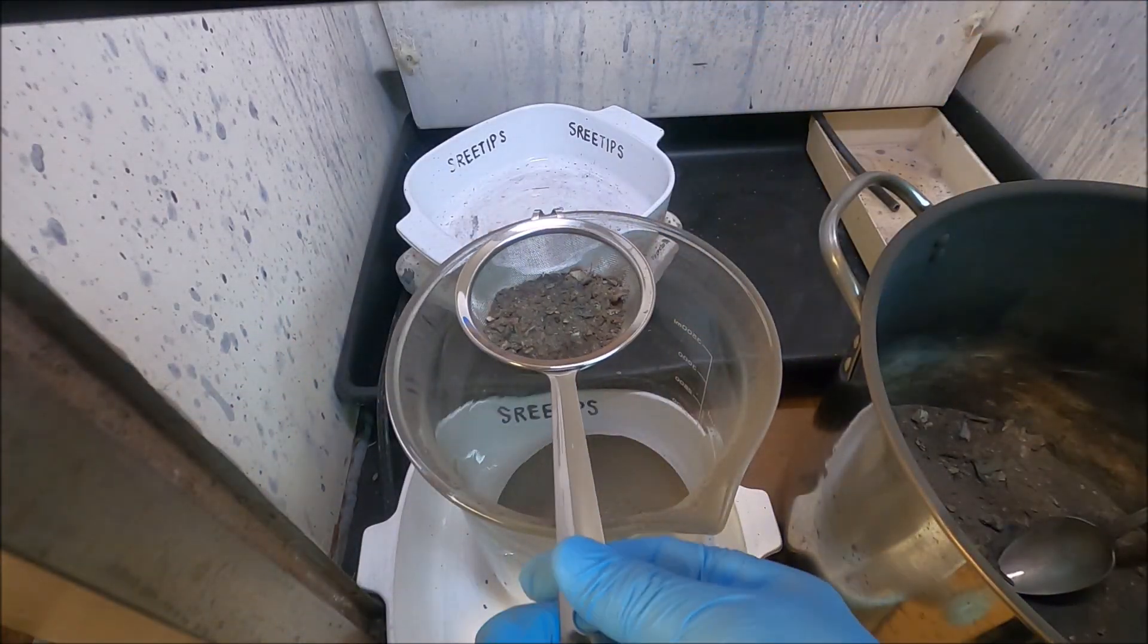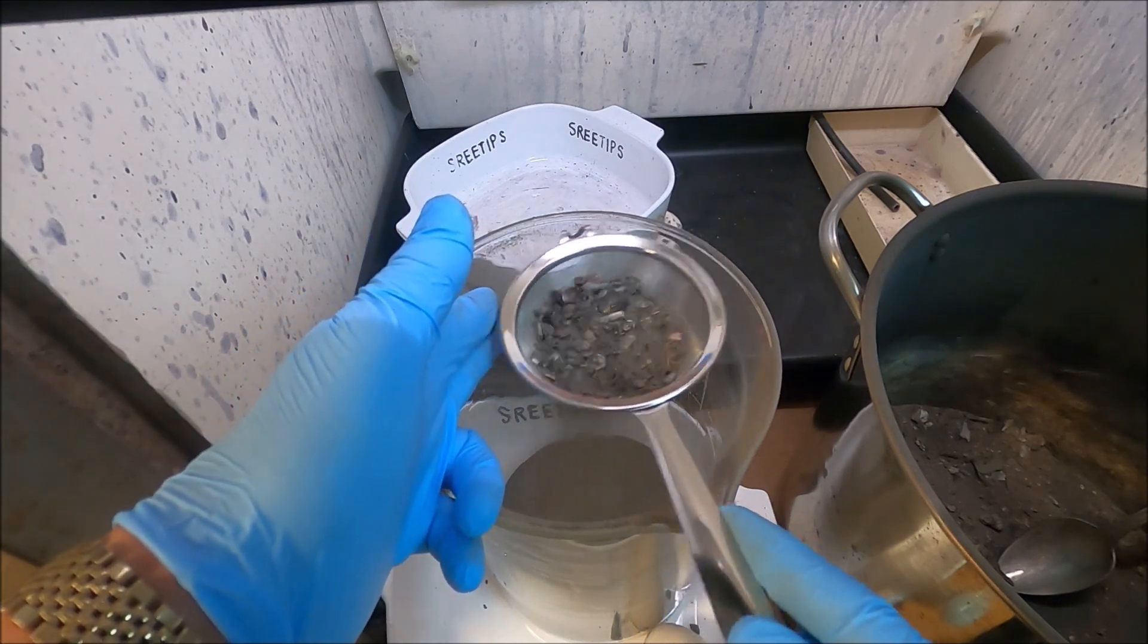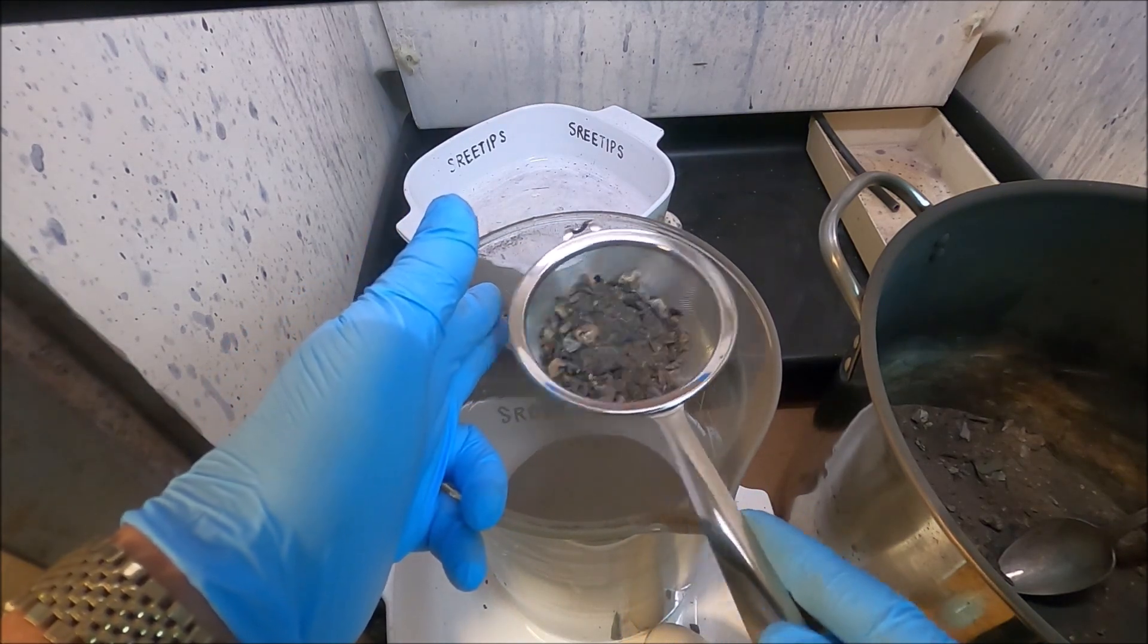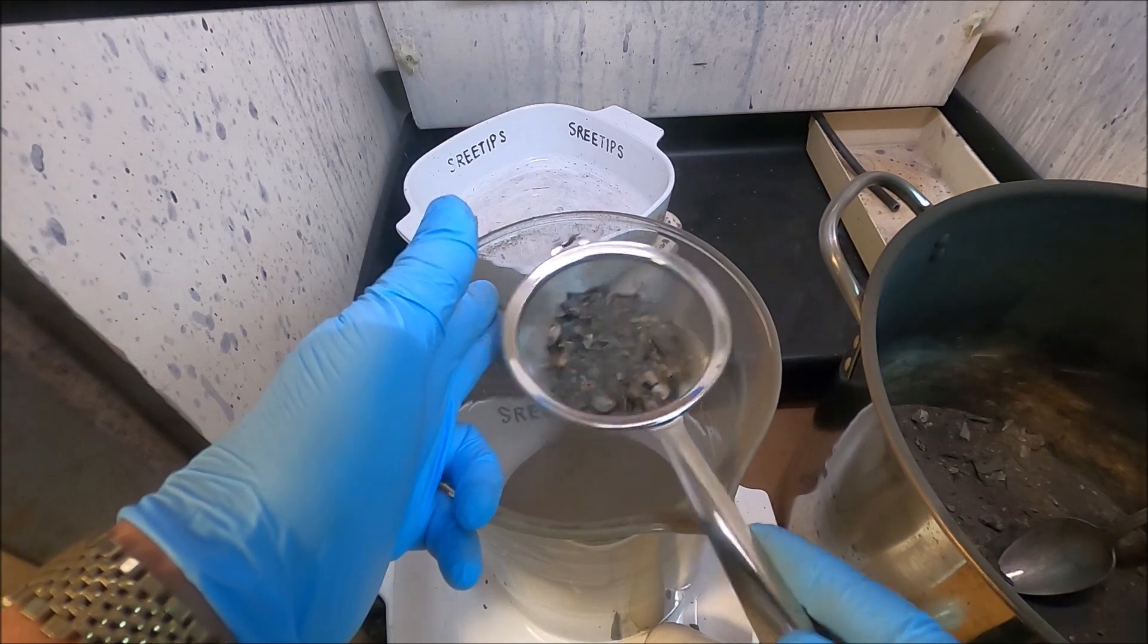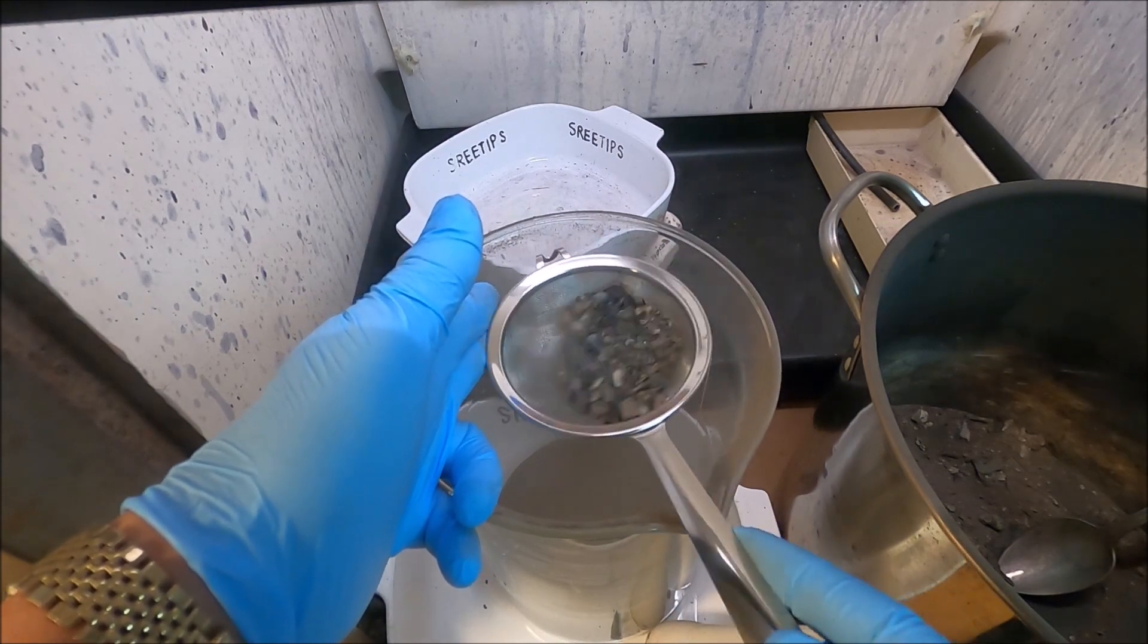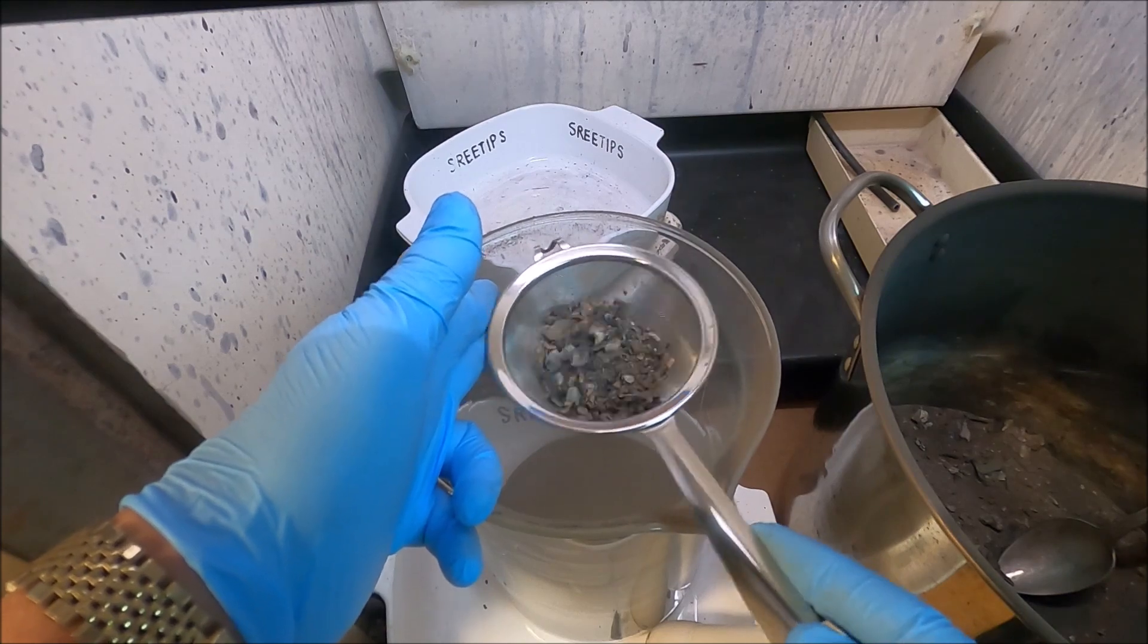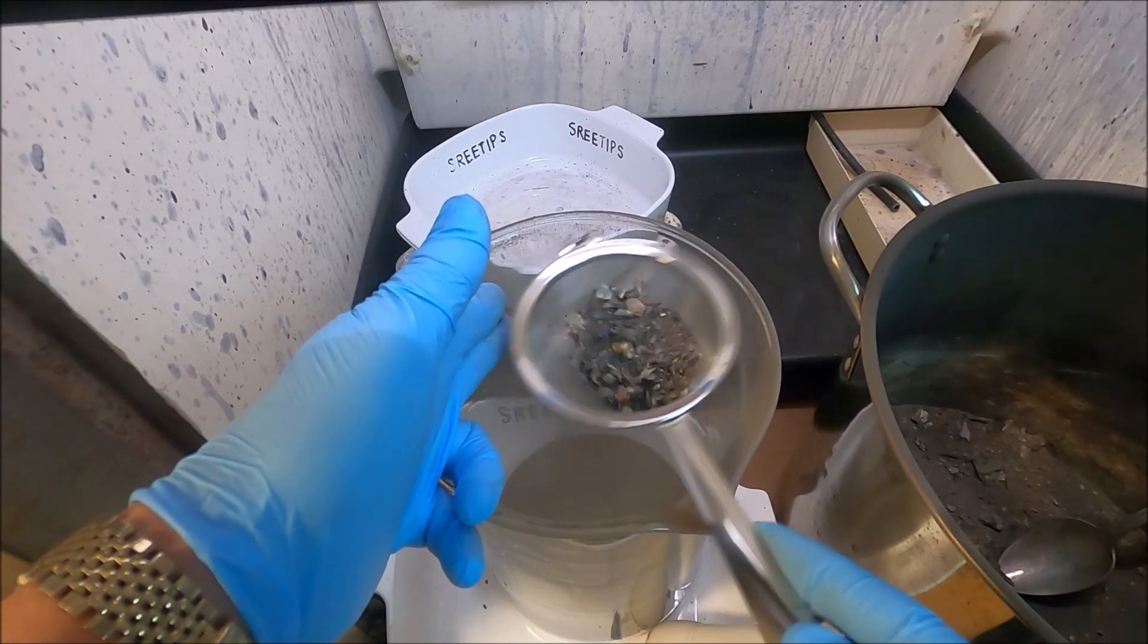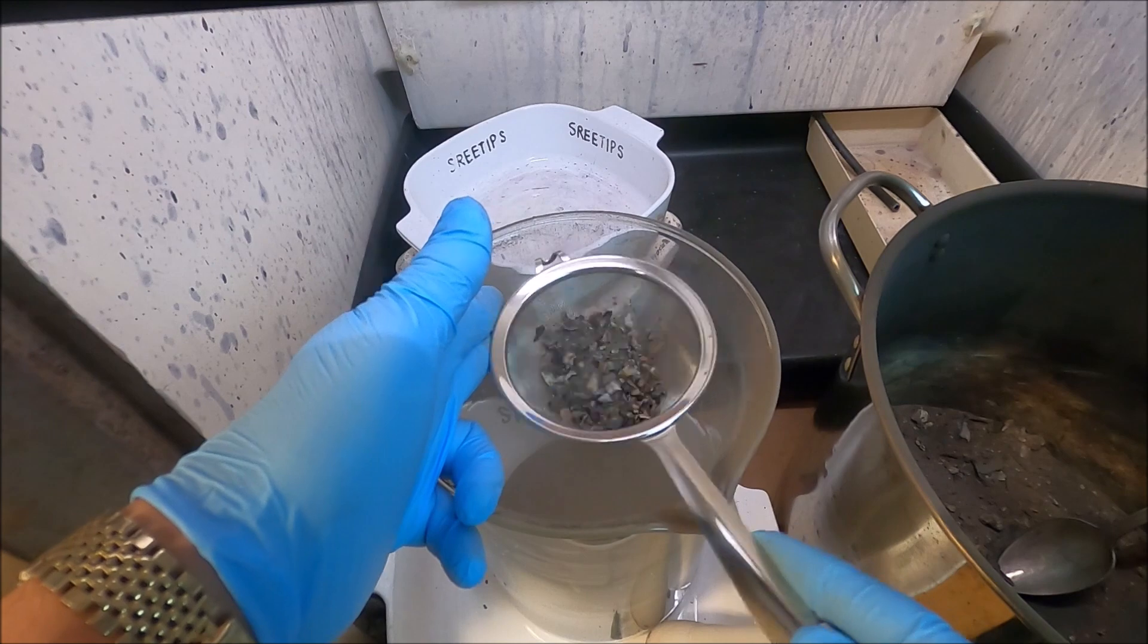Here's the entire sequence in real time. It took me about 30 minutes to get all the burnt filter paper material processed through that screen and into the beaker.